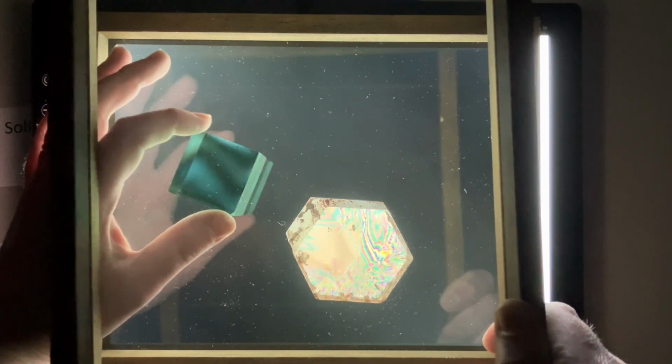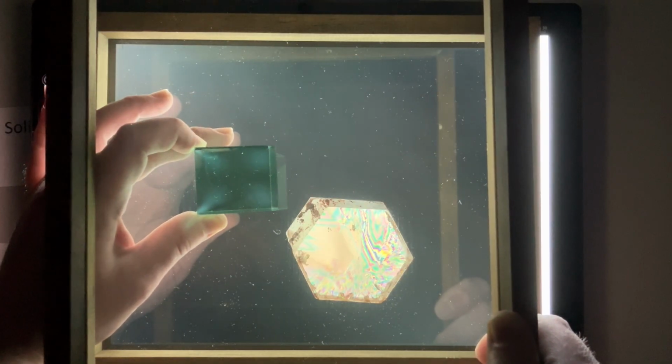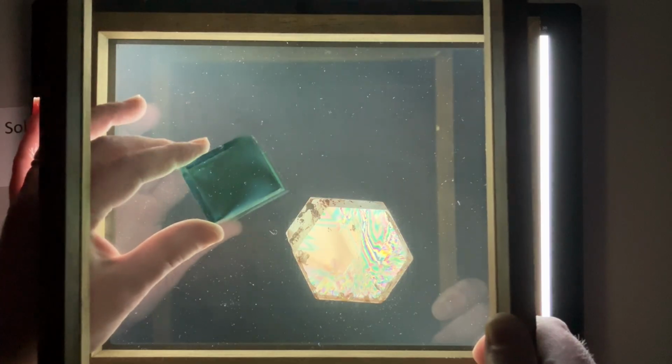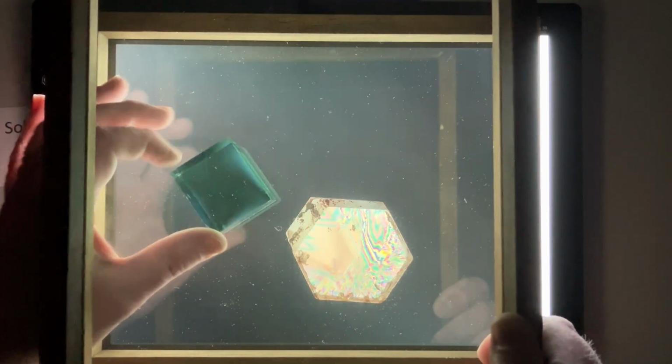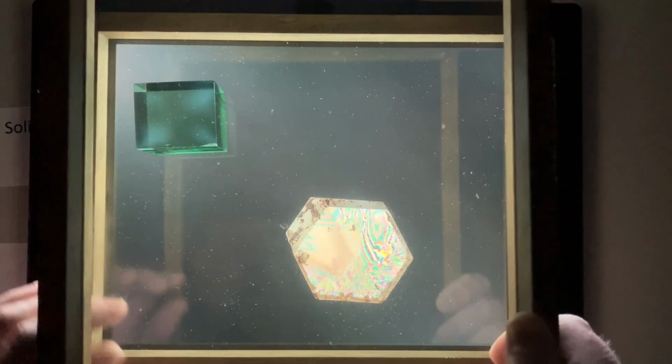And what that is actually is stress in our glass sample. A perfectly annealed piece of glass wouldn't have any of this really going on. It would just stay pretty much dark with crossed polarizers. But this is just a piece of cullet glass, so this is sort of like a leftover scrap from glass making. And this demonstrates one of the important industrial uses of polariscopes: to check on the stress of glass and plastic products in order to figure out how things might fail or break.